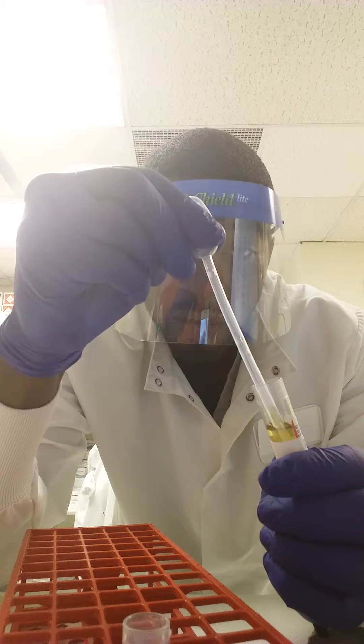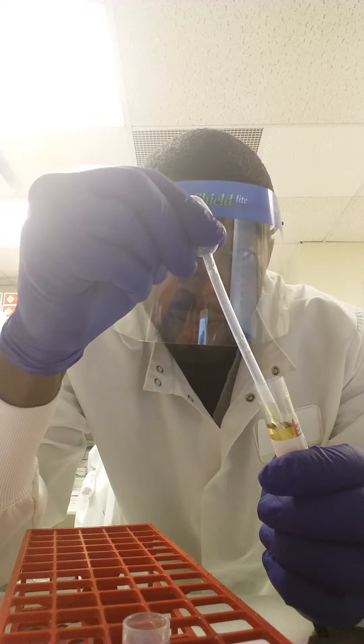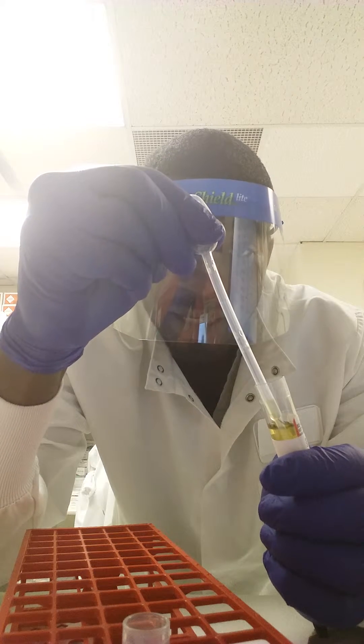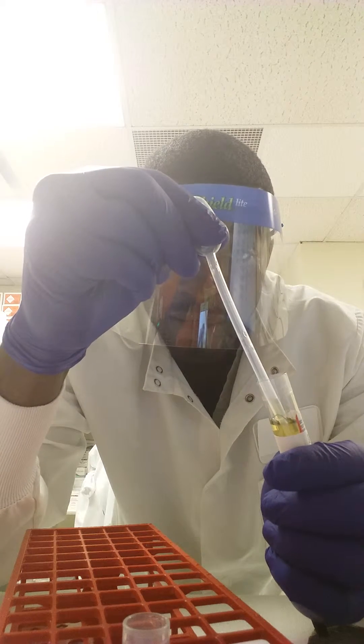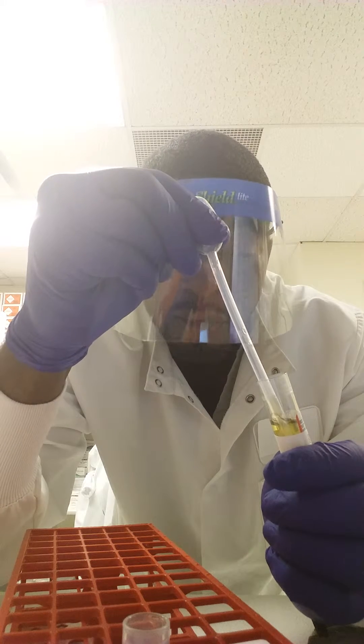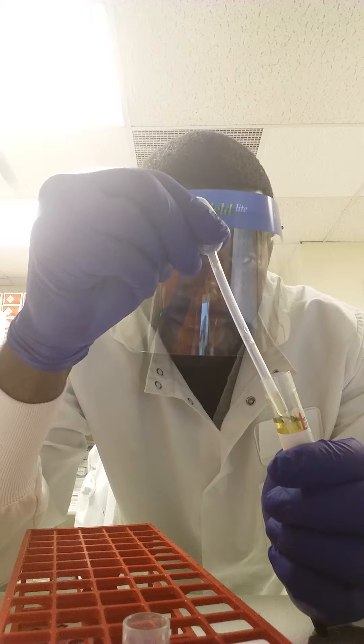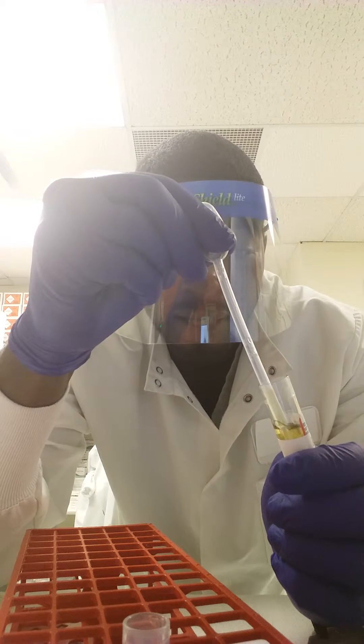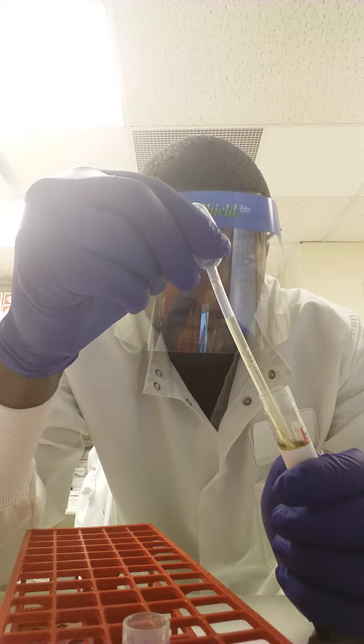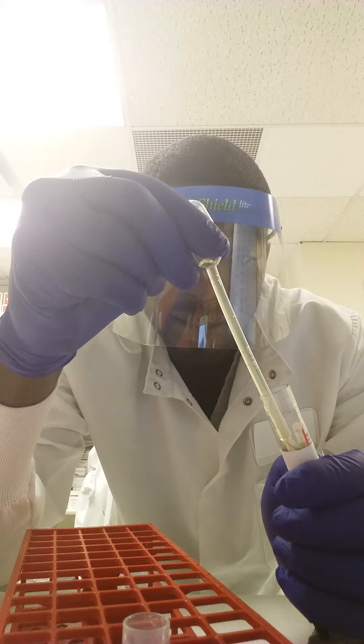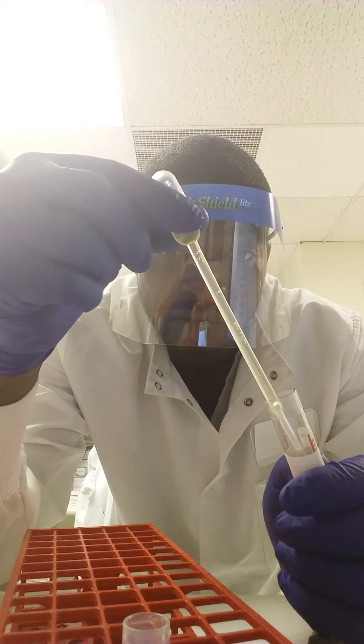Because if you go all the way down, the pipette is going to get mixed in with the gel and you don't want that to happen. The gel is not being tested, it's the serum. So you gently let go of the top portion of your pipette.